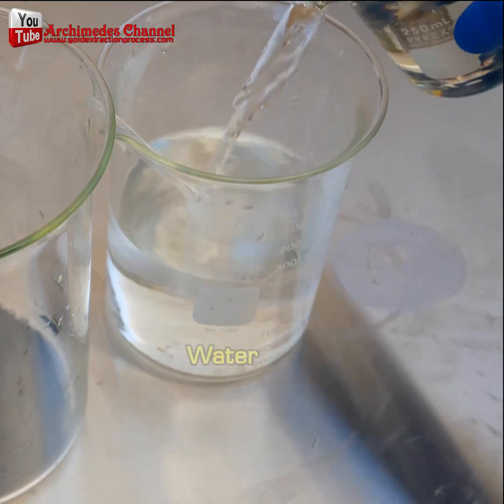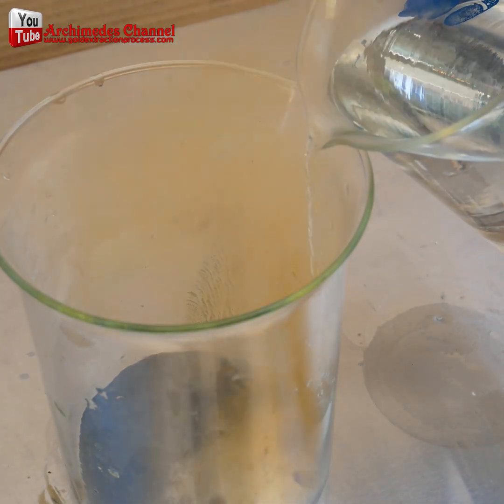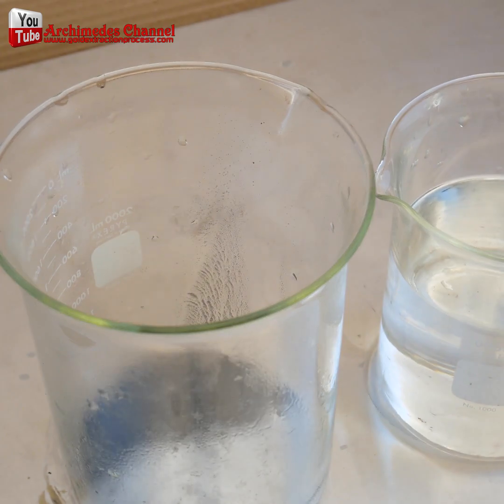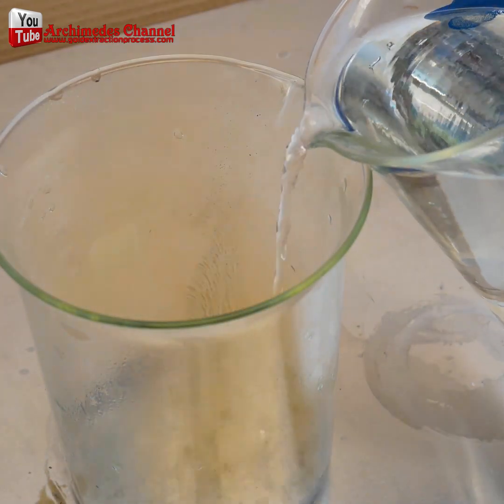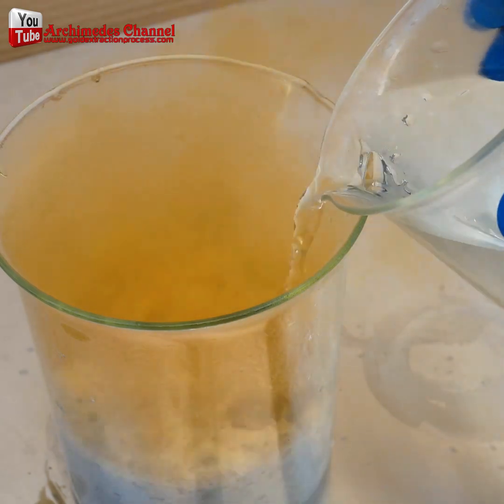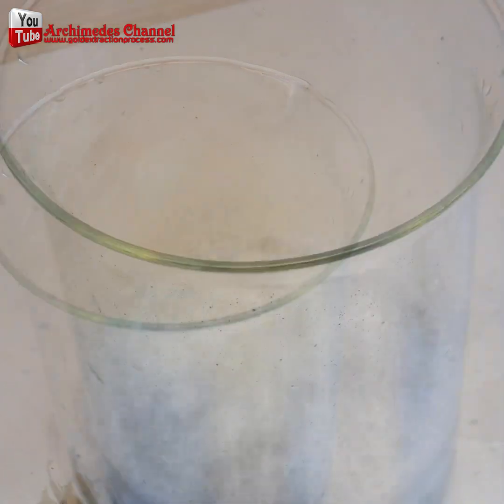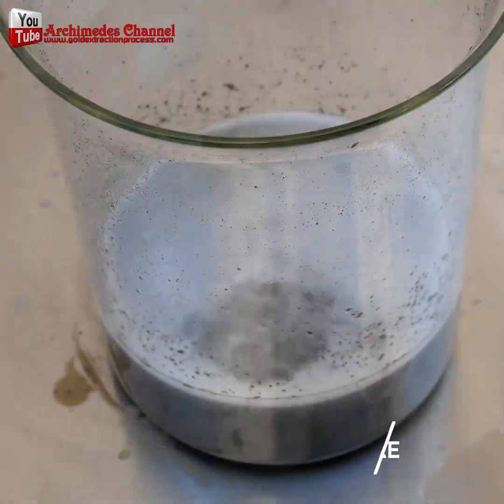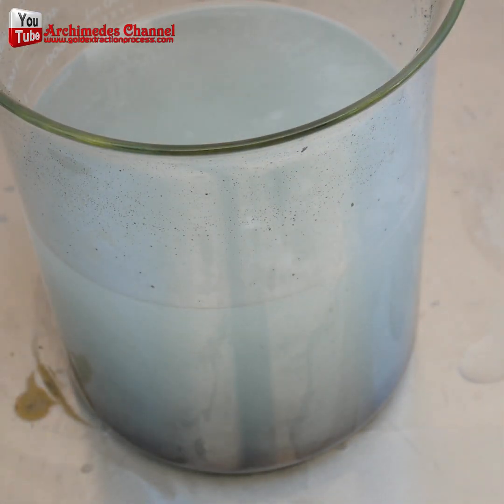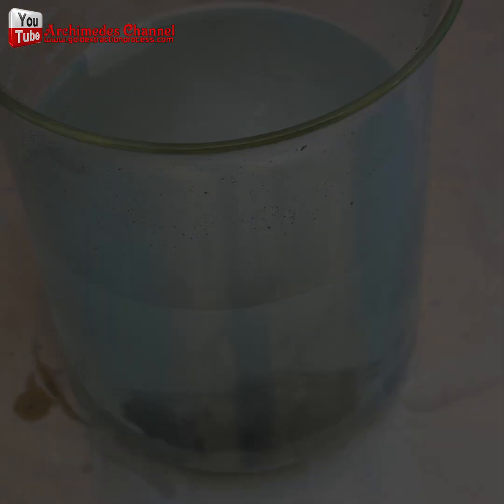You can see the beginnings of that black sludge. It's time to create an aqua regia solution to help separate it. Just look at the vapors and steam coming off of that — probably not something you want to be inhaling. The chemical reaction is underway, with more exhaust piling out of that beaker, fizzing up as the reaction takes place.